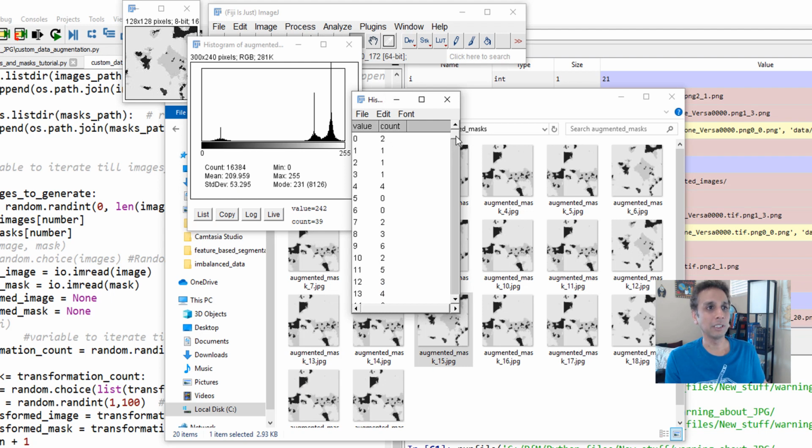2, 1, 1, 4, it's almost like I have these many pixels. At 33, I still have 236 pixels, but some of them are assigned a pixel value of 27 or something. You keep going and then you see another small peak. Oh, I don't even see anything at 65. I'm supposed to have something at 65. And do I have anything at 201? This is a completely screwed up image. I don't know why we work with JPEGs for scientific imaging anymore.